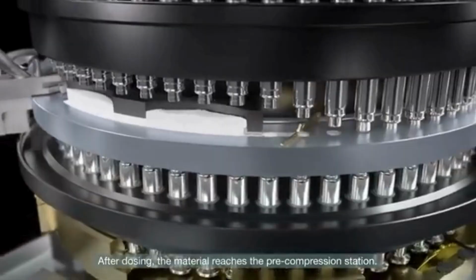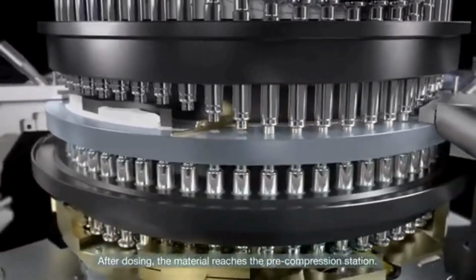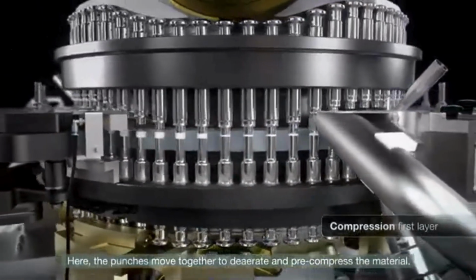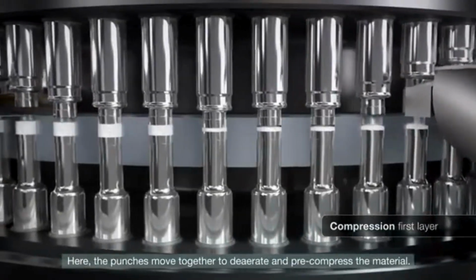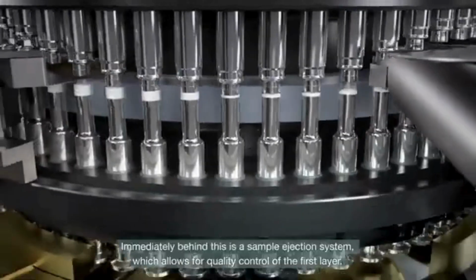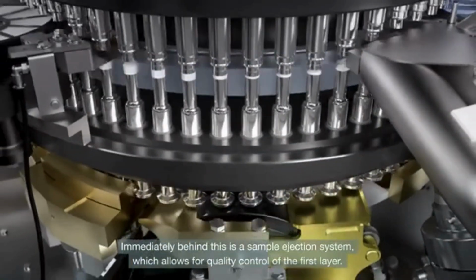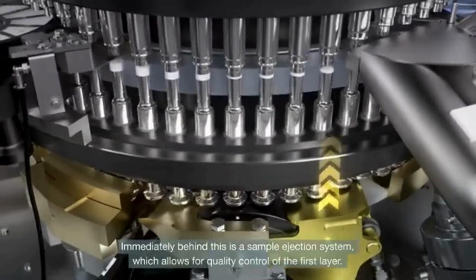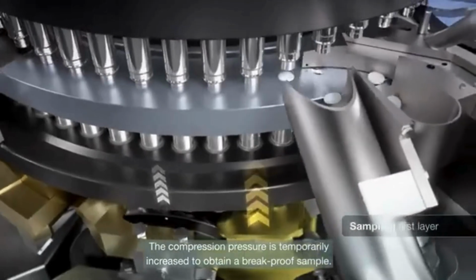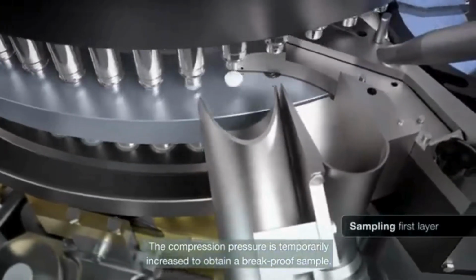After dosing, the material reaches the pre-compression station. Here, the punches move together to deaerate and pre-compress the material. Immediately behind this is a sample ejection system, which allows for quality control of the first layer. The compression pressure is temporarily increased to obtain a break-proof sample.